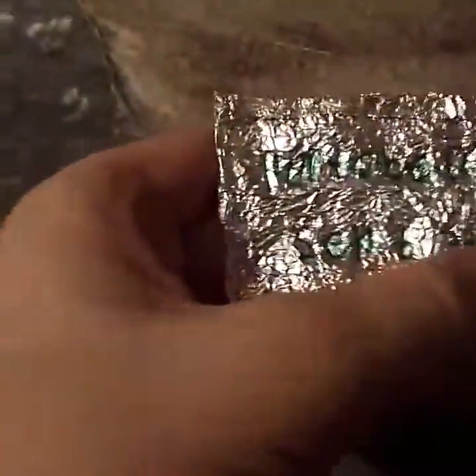So here it is — the spore print. It says portobello right up here and then it says September 6th, 2017. The light is a little weird in here but I can see the spore print pretty well. I don't know how good y'all can see it, but that's the center and then that's the outside.